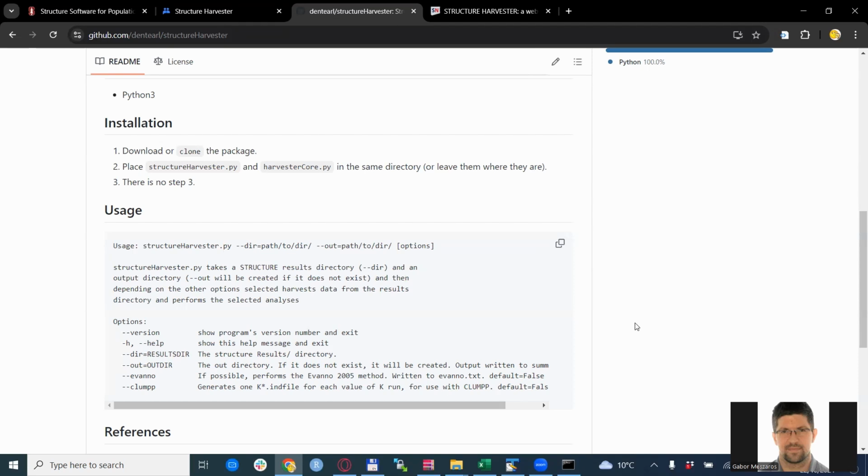These will be text files. And if this directory doesn't exist, it will be created, so you don't need to worry about specifying an existing directory. Afterwards, you put the options. We will consider right now --evanno to run the Evanno method, and the results will be written into the evanno.txt file.